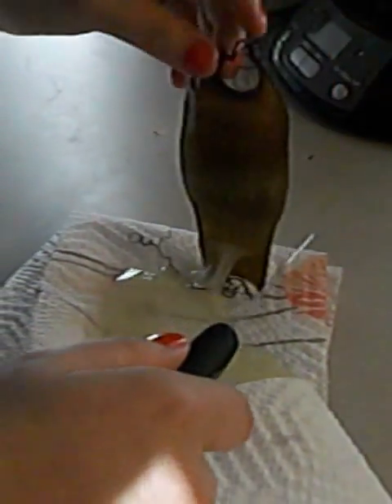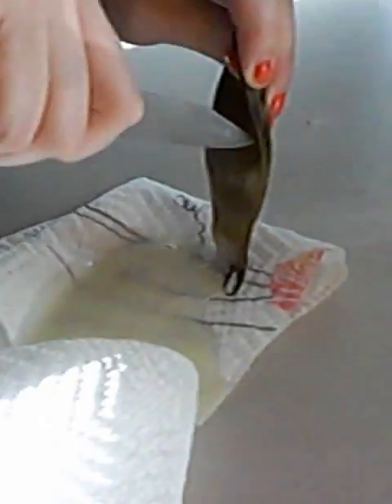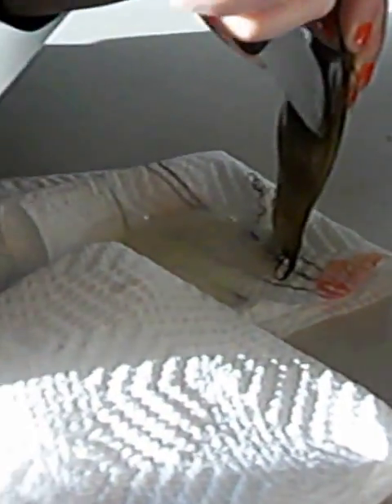Is there something still in there? I don't know, but it's making noises. It's alive. No, it's not — they're like squishy noises. A shark's gonna come out. God, this is really tough. These shark babies are protected — good going, mom. Oh my god, I'm obviously not cut out to be a marine biologist.